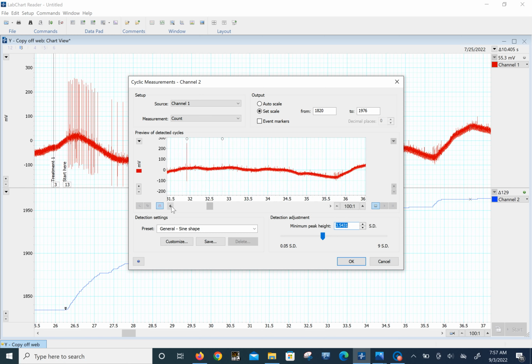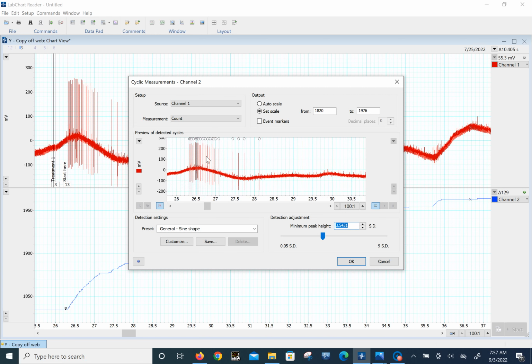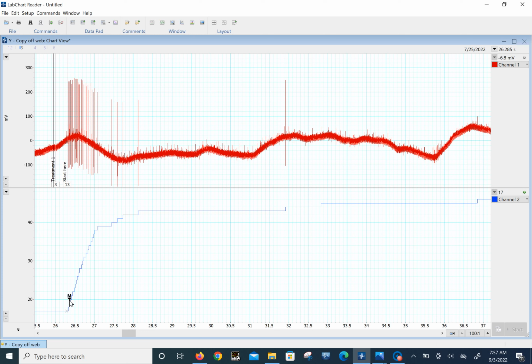So what did we count in there? There's one small one it counted. It counted this large one, and it counted all these large ones. That's a standard deviation of 3.5. Let's see what that does. Go over here to auto scale, move our little marker up here at the beginning of this trace, and we go over, watch the time up here. We're going to go over to 10 seconds. And 999, well, good enough for government work. It's not changing anyway. And we get 28 counts. As you can see over here in this little circle, 28 counts. So there's 28 large spikes.